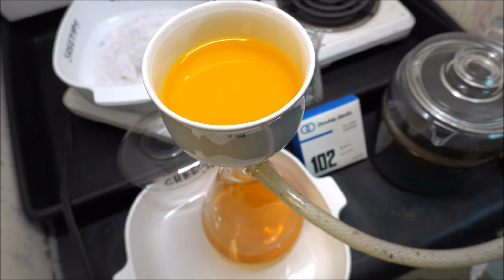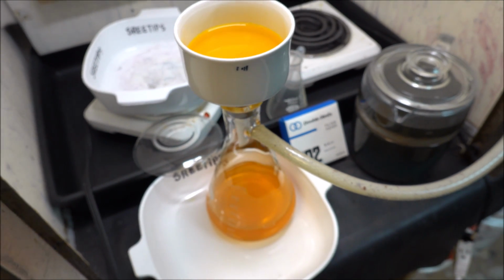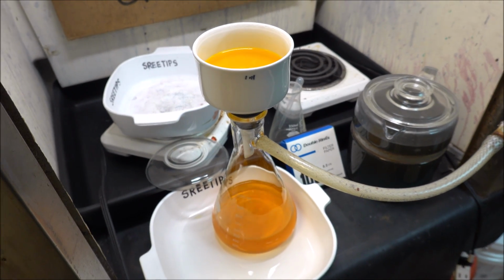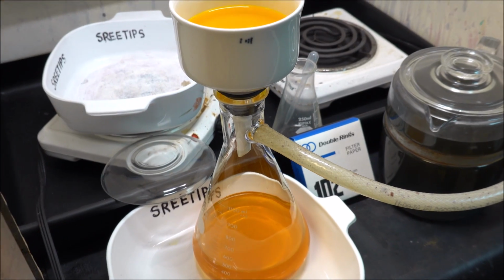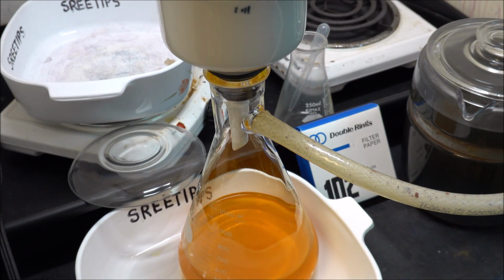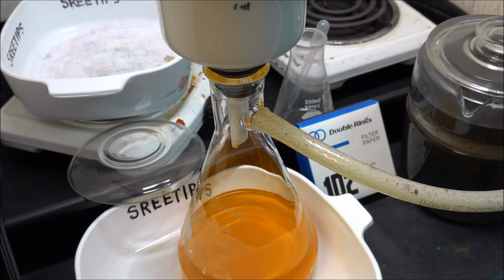The solution has been filtering under a vacuum now for about half an hour. I just wanted to show you how much it's slowed down here. I got just drips coming out of that funnel now. I remember when I first started refining, I used to just throw everything right into the filter. Sometimes it took hours for all of the solution to be pulled through that filter.